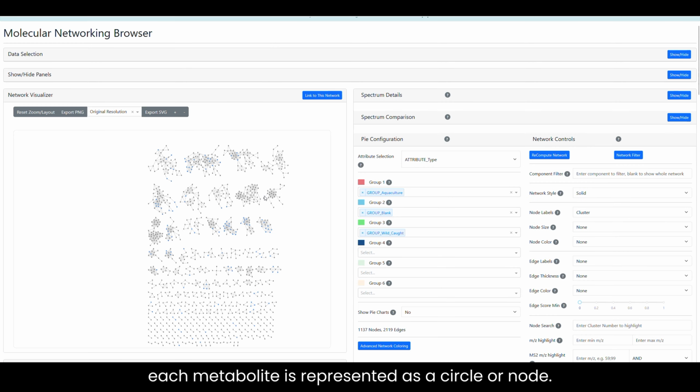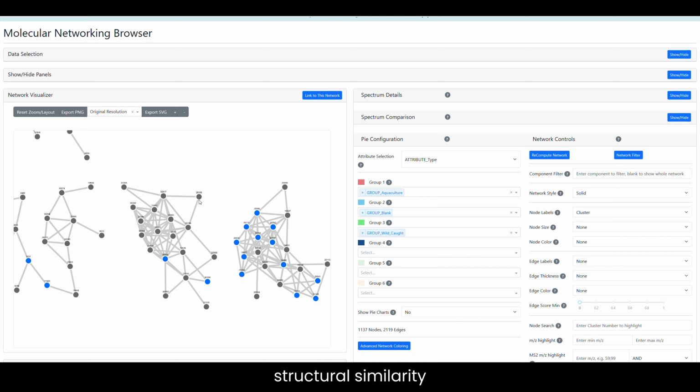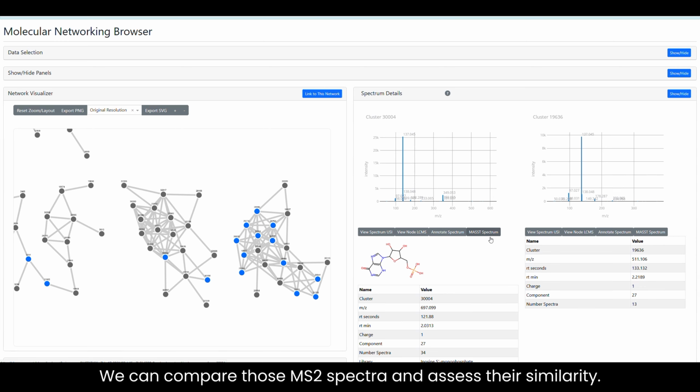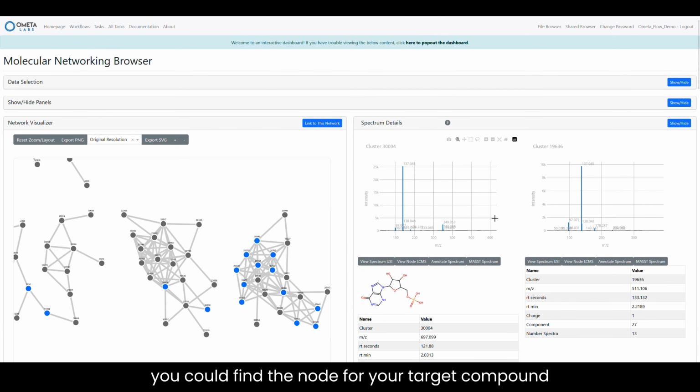In a network, each metabolite is represented as a circle or node, and compounds that have structural similarity are connected by an edge between the nodes. Blue nodes have library matches, while gray nodes don't. However, by clicking on the edge between a blue and gray node, we can compare those MS2 spectra and assess their similarity. For example, you could find the node for your target compound and check out if it has any connected nodes, which are likely to be degradation products or other structure-related compounds.